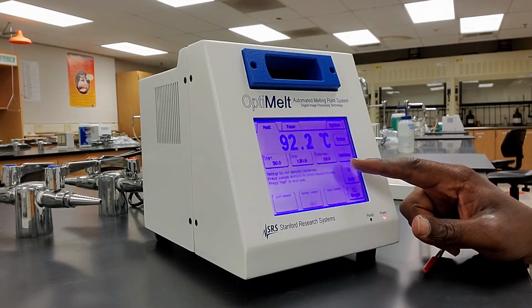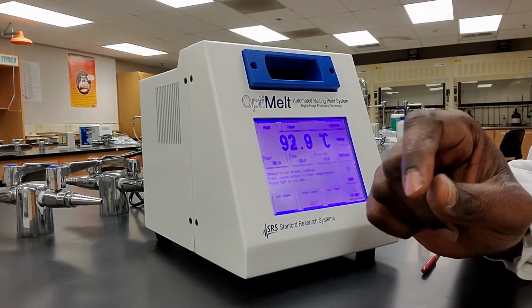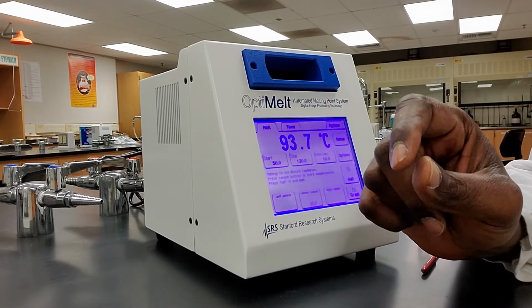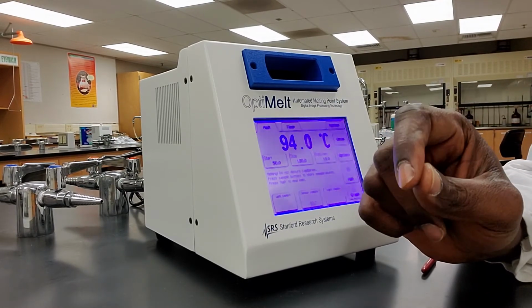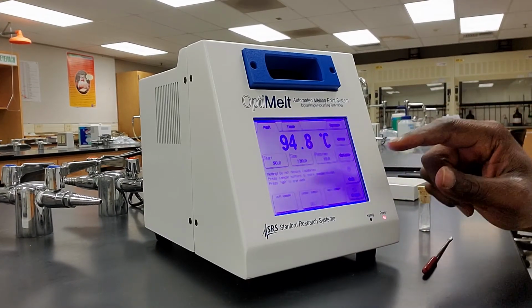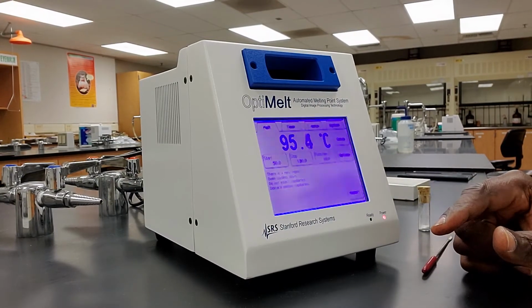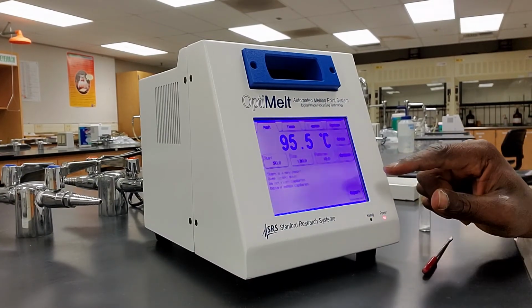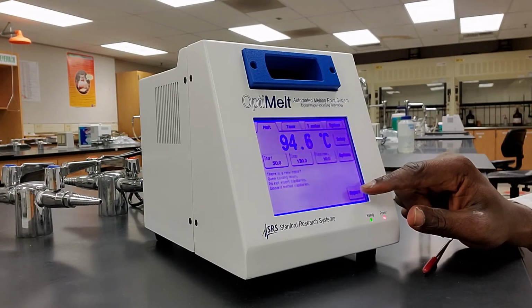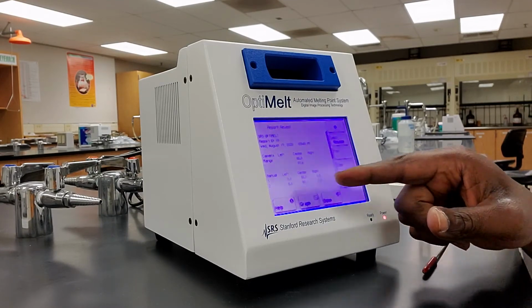I'm going to press halt because I have pressed the button when I saw the solid becoming a liquid, and I pressed the button again when the last bit of the solid sample became a liquid. And so as I'm done, I'm now going to halt the whole process. So I'm going to press this report button. You can see this report button here. When you press this report button, it will tell you.